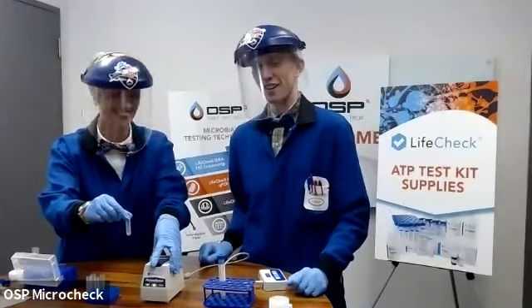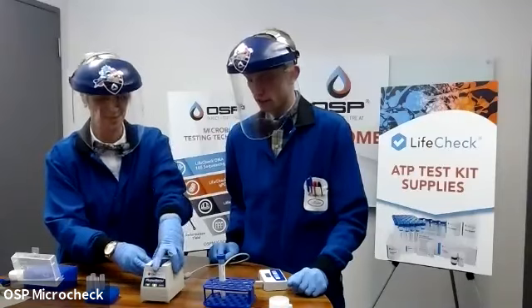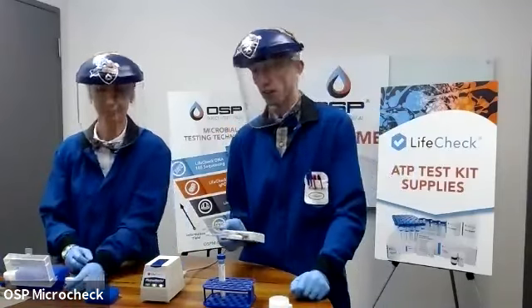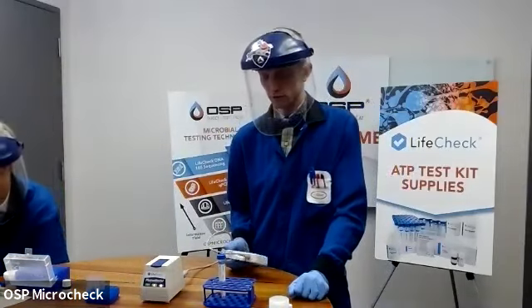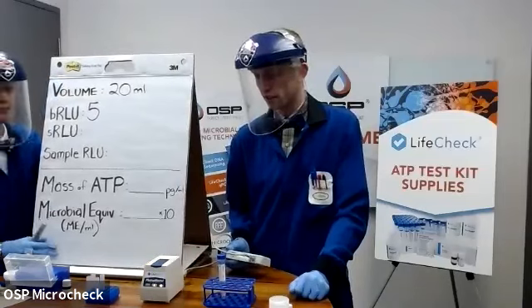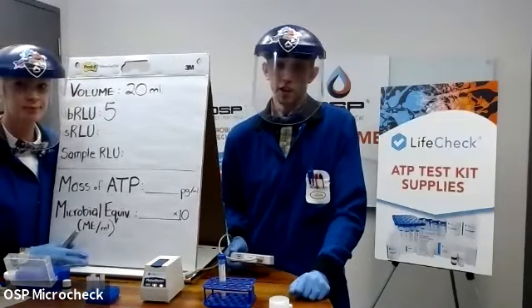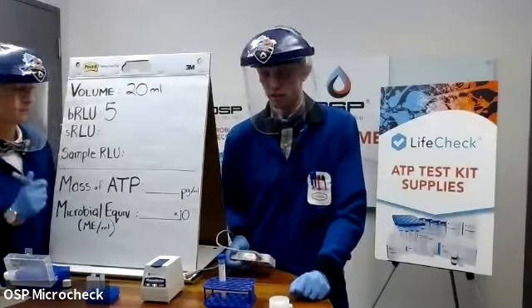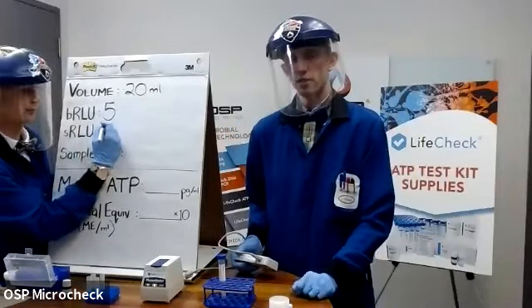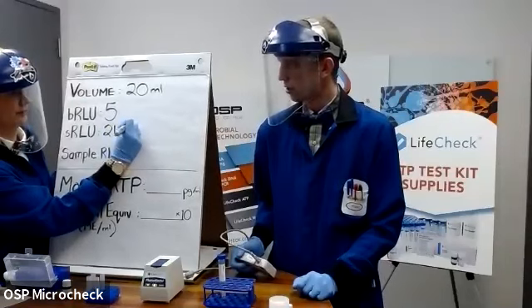2 drops is going to be 100 microliters. Virginia gave it a little tap, a little swirl to mix it up, and dropped it into the luminometer. I'm going to hit the green button once to take a reading. And now we're aiming for 5,000 RLUs here as an indicator of a healthy enzyme. But to be honest, these things are typically around 15,000 RLUs or higher. And for this one, we managed 21,184. So very healthy enzyme, ready to go.